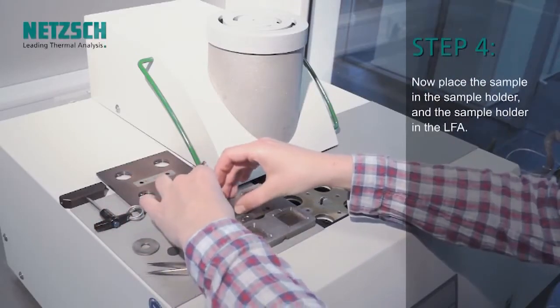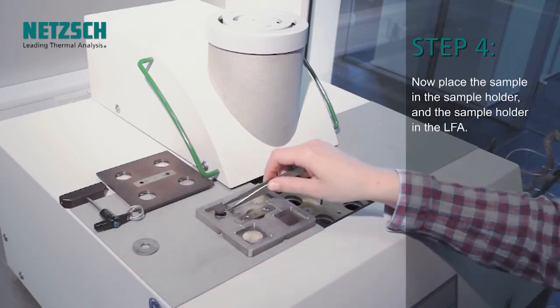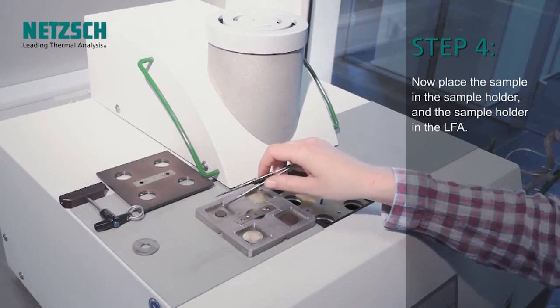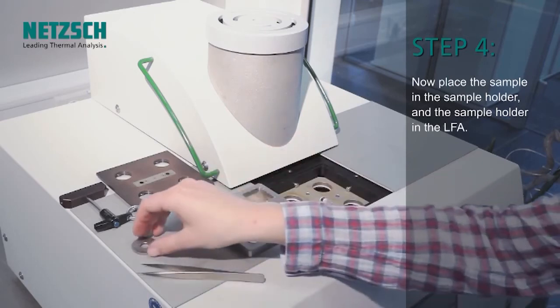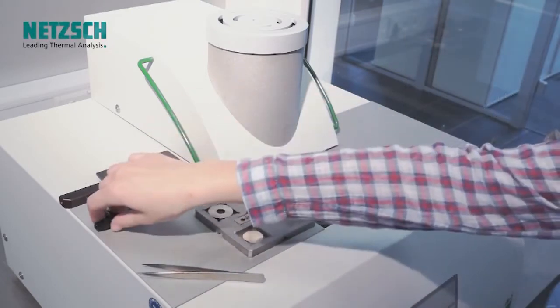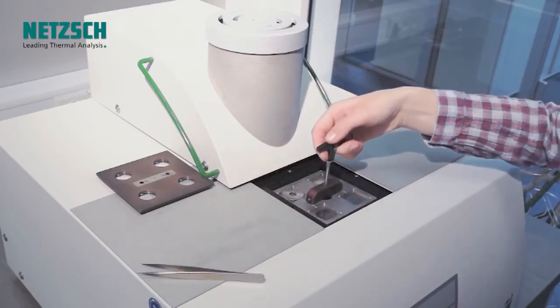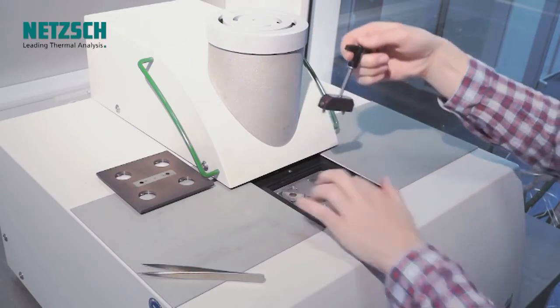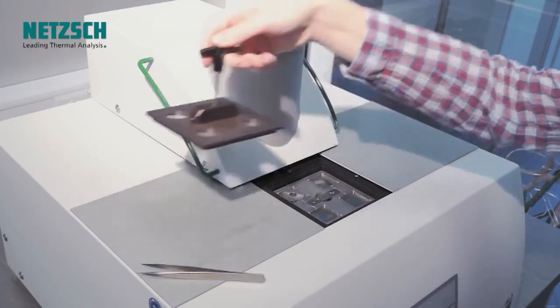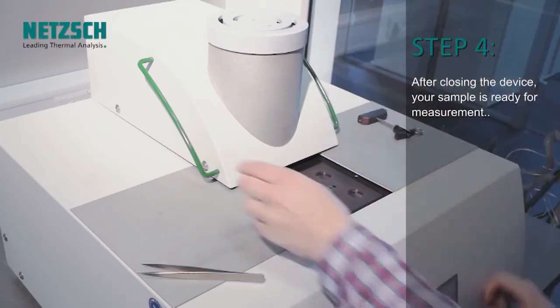Now place the sample in the sample holder and the sample holder in the LFA. After closing the device, your sample is ready for measurement.